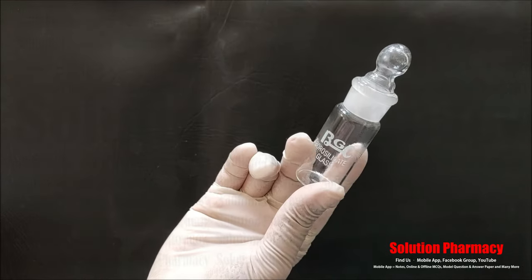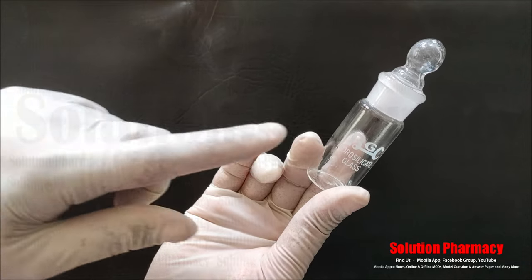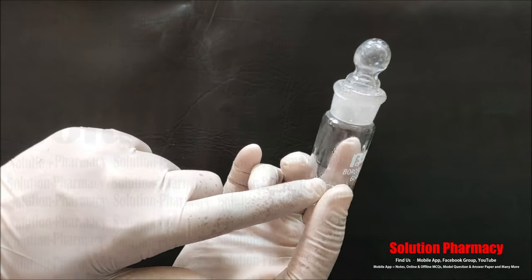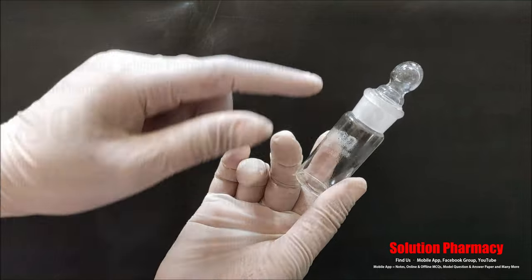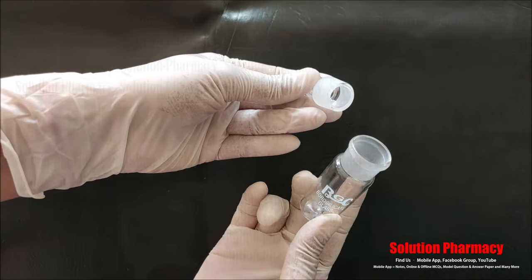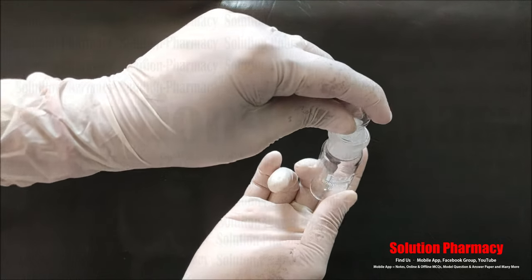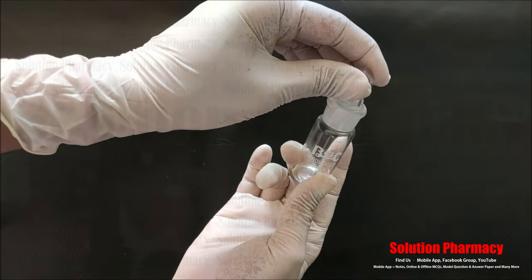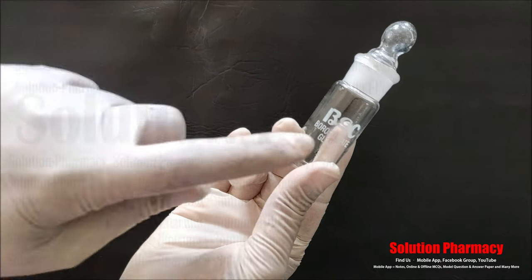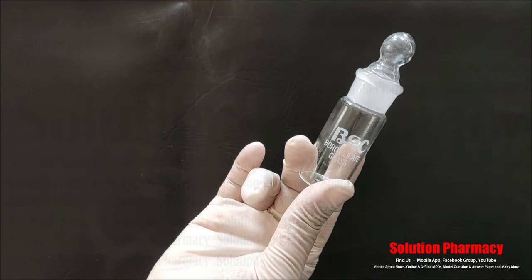Next, this glassware is called a weighing bottle, commonly used in laboratory work. We use this glass container to weigh some laboratory reagents or solids. A glass cap is used to cover this bottle so that reagents or solids to be weighed are protected from contamination. In this weighing bottle we can weigh solids with very precise measurements.